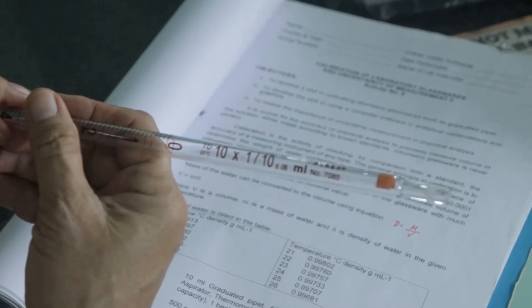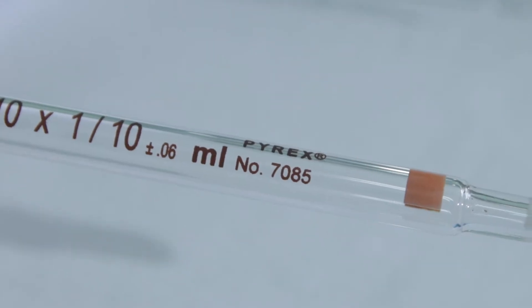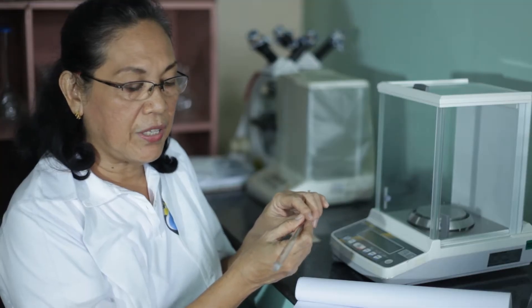To start with, we're going to get the serial number of this pipette. The serial number of this pipette is number 7085. This is what you're going to write into the lab guide — the pipette serial number is 7085.